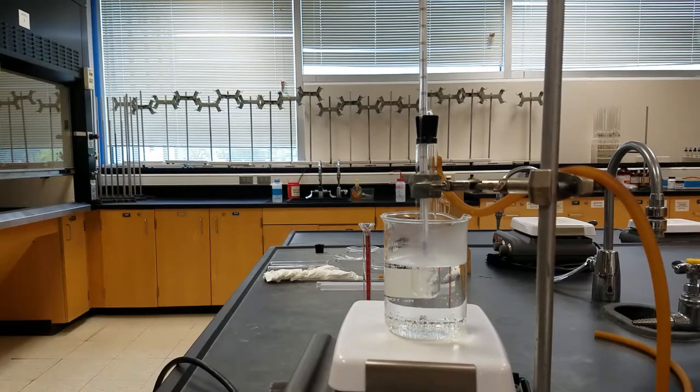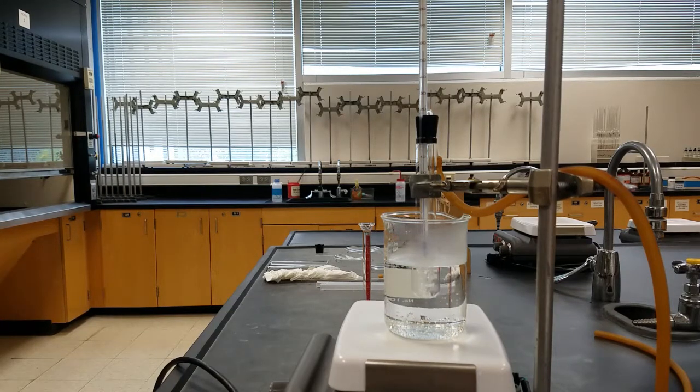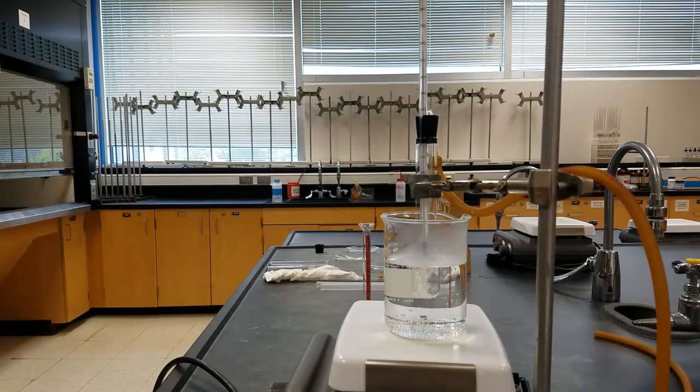The boiling point of this liquid has been reached. We know that it's the boiling point because there's a free and rapid boil. The liquid is condensing on the thermometer and the largest sign is that the temperature has leveled off and is no longer rising.